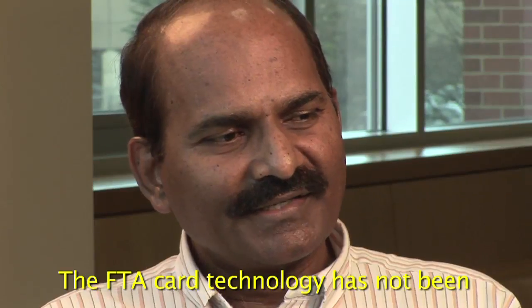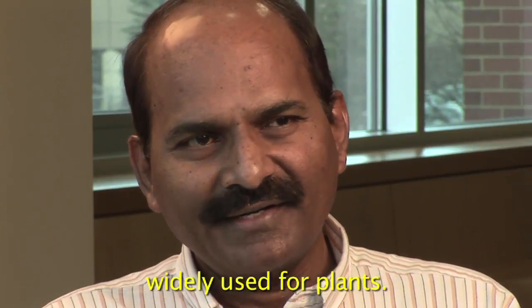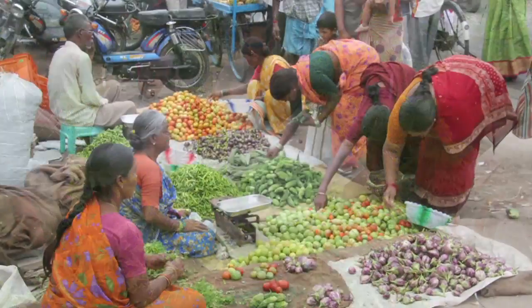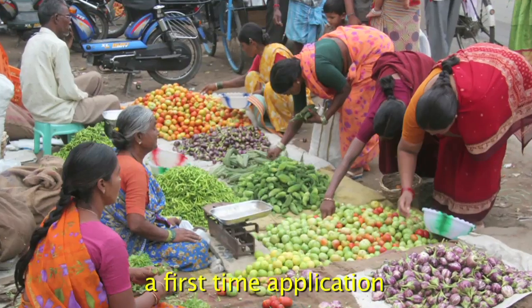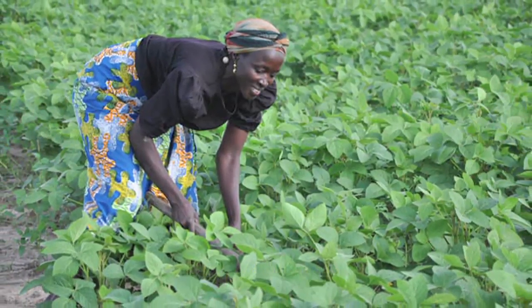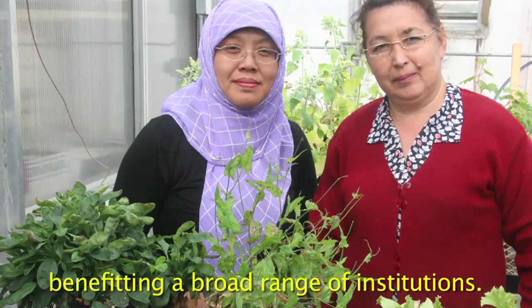FTA card technology has not been widely used for plants, so I would consider this as a first-time application on a wider scale, benefiting a broad range of institutions.